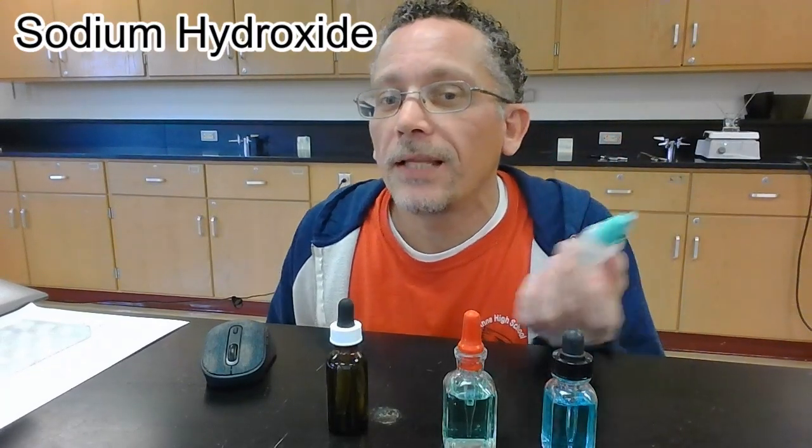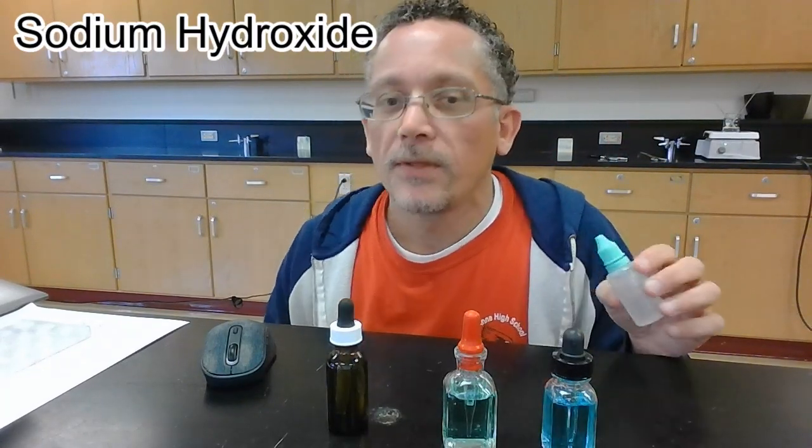We can test for nickel 2 ions by adding sodium hydroxide. We should get a light green precipitate if it contains nickel 2 ions, and adding more will not dissolve the precipitate. So let us go ahead and set this up and perform some of these tests and see how it goes.